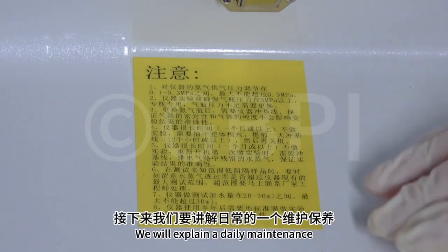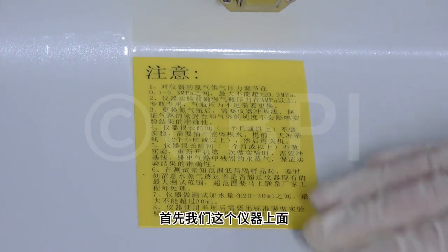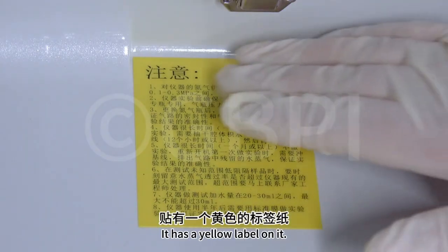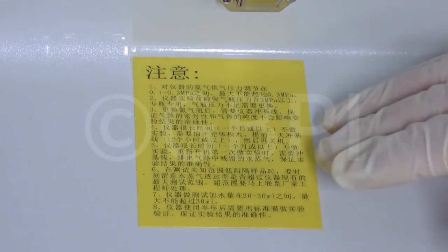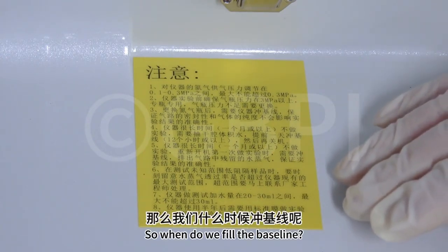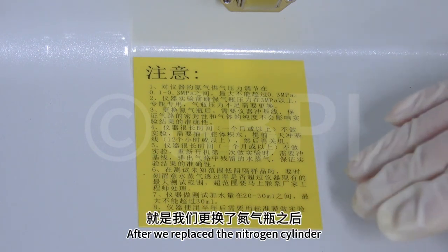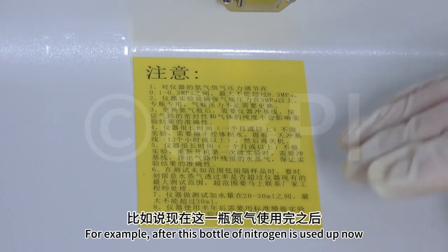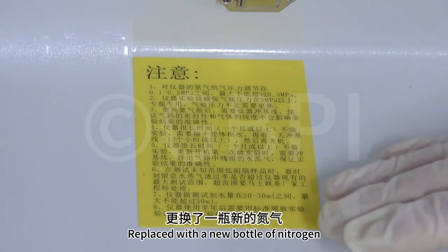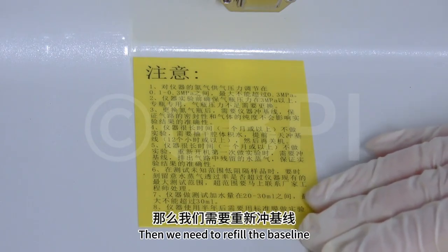Here we go. We will explain daily maintenance. First of all, this instrument has a yellow label on it. Here's a hint: when do we fill the baseline? So here's the first scenario. After we replace the nitrogen cylinder. For example, after this bottle of nitrogen is used up and replaced with a new bottle of nitrogen, then we need to refill the baseline.